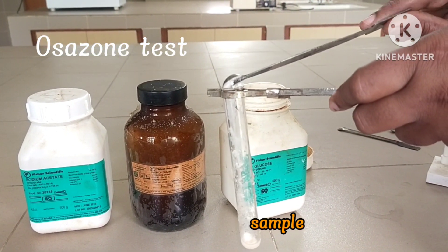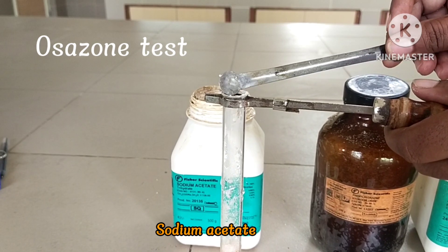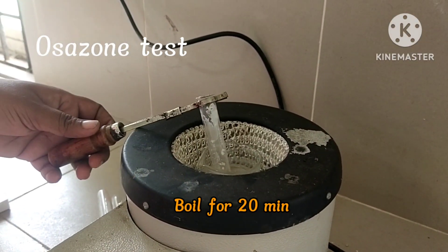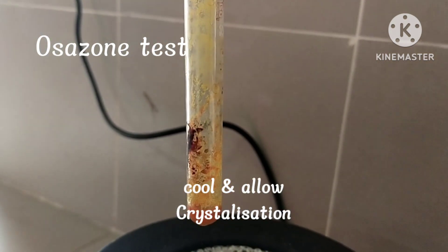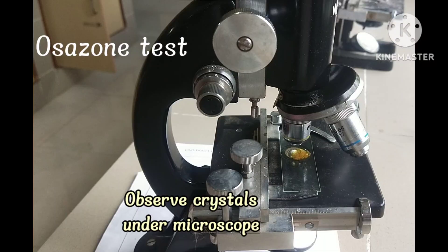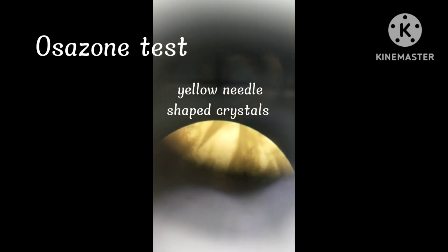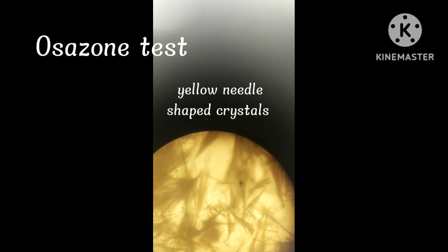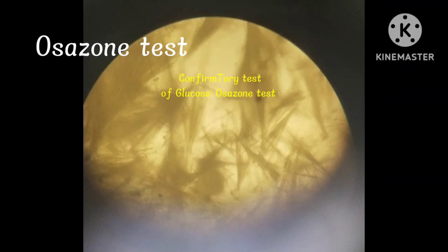Procedure: To the test tube, add 0.2 grams of sugar, 0.4 grams of phenylhydrazine hydrochloride, 0.6 grams of sodium acetate, and 1 ml of water. Boil the solution for 20 minutes. Cool and allow crystallization. Observe the crystals under a microscope. Yellowish needle-shaped glucosazone crystals are observed — it is a confirmatory test for glucose.